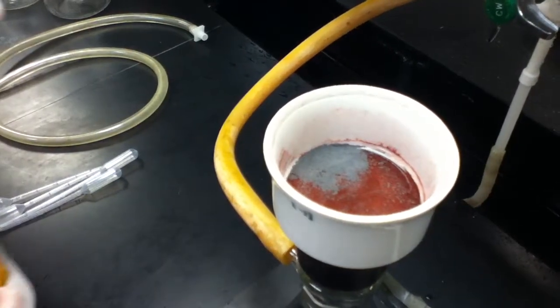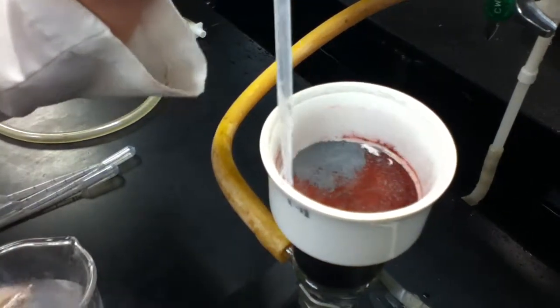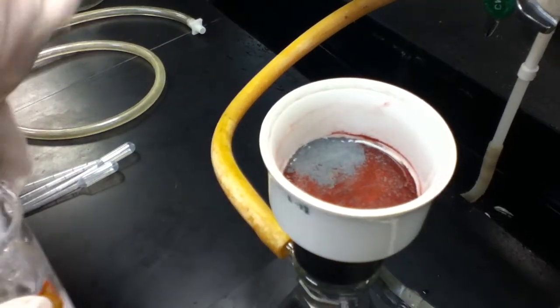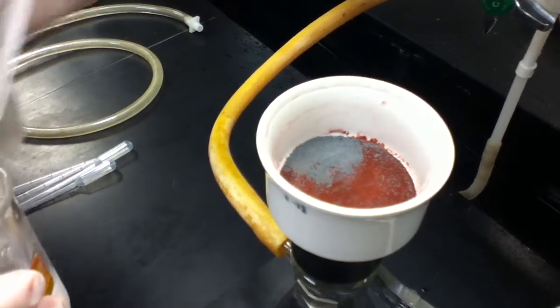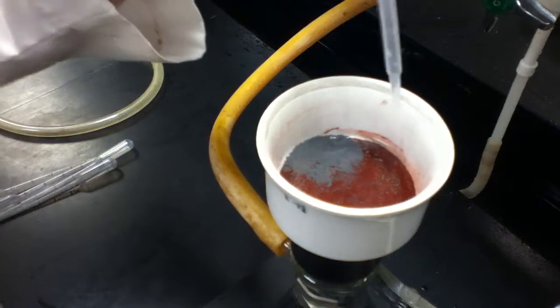So, now we are washing it with some DI water. Boiled water that's been chilled. It's still been boiled. Yes. You are correct.